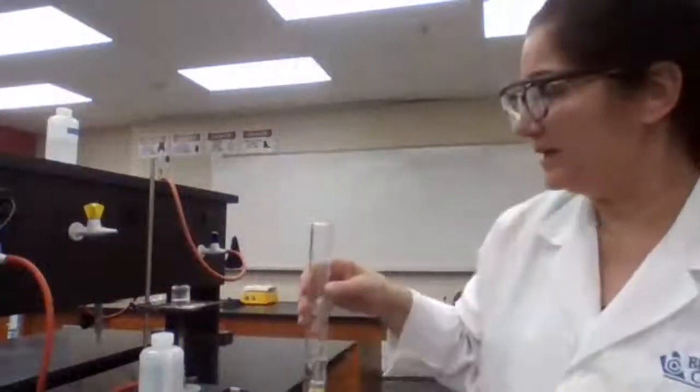You can read in milliliter, but because it's solid, you can translate that to cubic centimeter. 1 milliliter equals 1 cubic centimeter. The volume for a solid object is expressed in cubic centimeter or cc, and for liquid is expressed in milliliter. But the numerical value is the same. For every milliliter, you get 1 cubic centimeter.